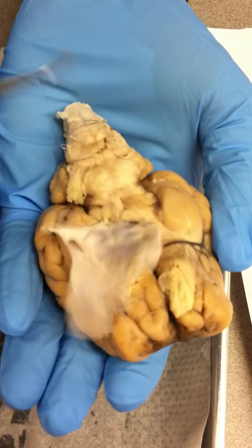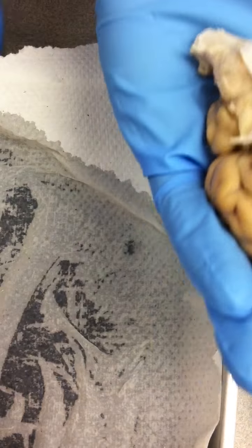And then dura mater, right here, is this. Pulling out kind of. Keep the brain. We just need the tract. Here, we're going to take the half a brain too. Oh no, they got that, right? Yeah, we got it. You're welcome. One of you's got it.